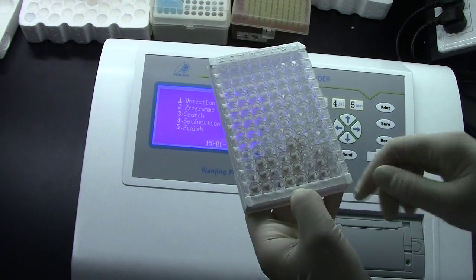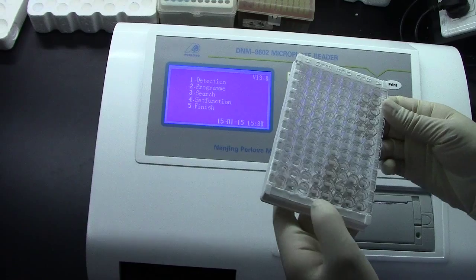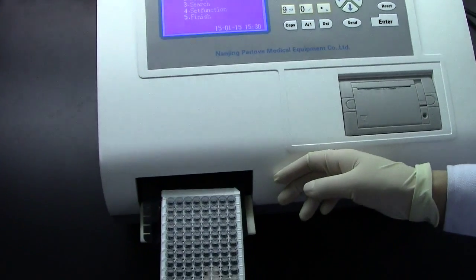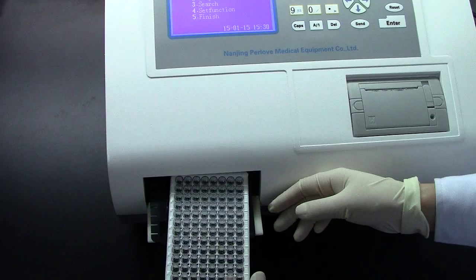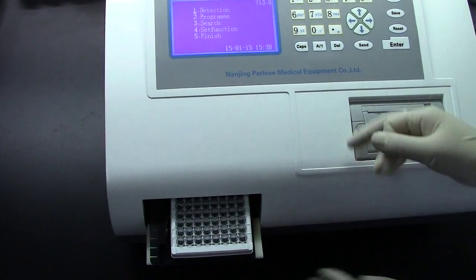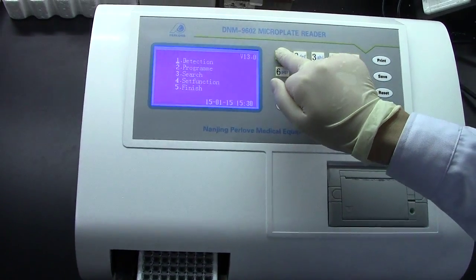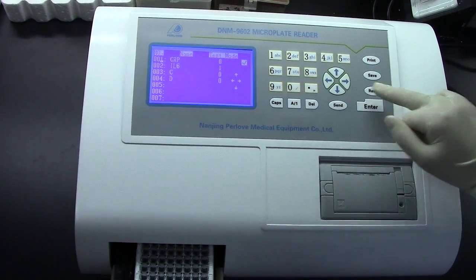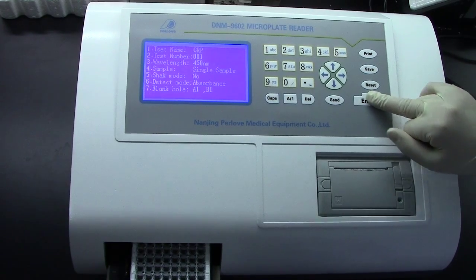After we get the sample inside, put the A on this side. Press 1 — detection. We test CRP this time.